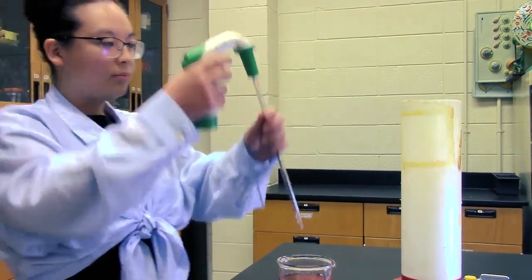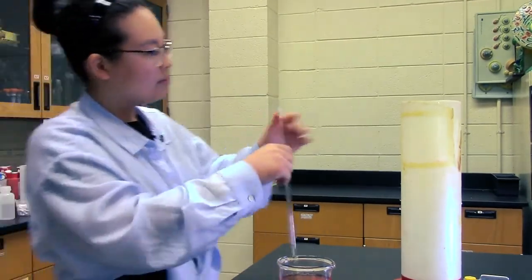Once you're finished using the pipette, release all the liquid from the device and then place it in this container so it can be cleaned.